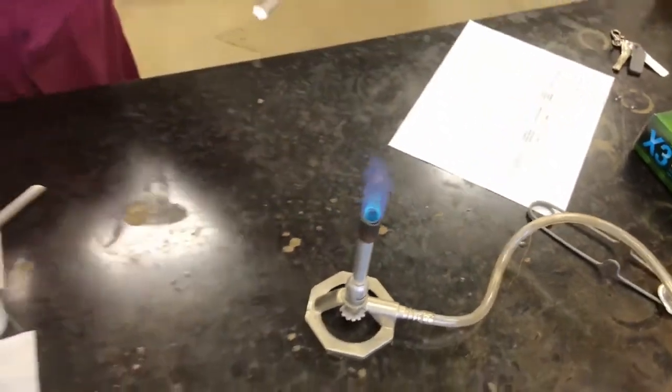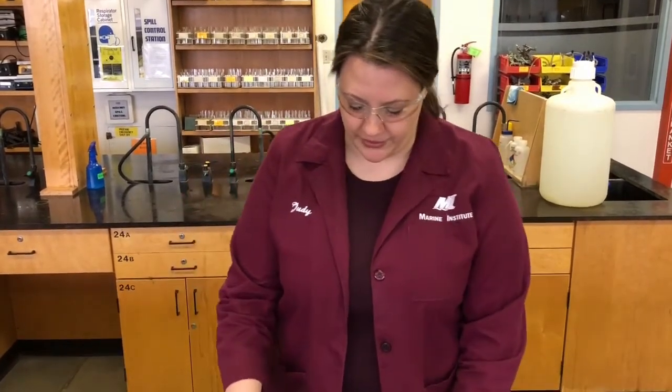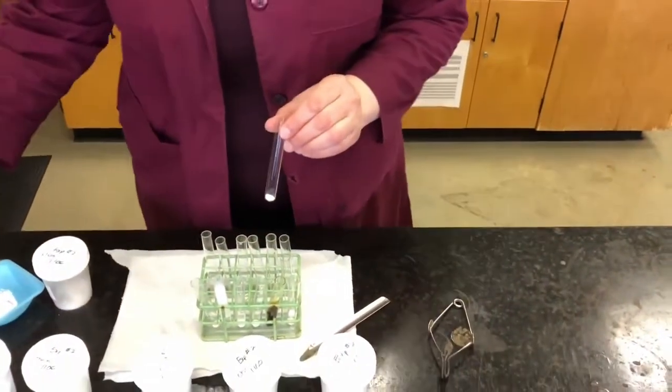So far we have a white powder with no effect from heat. So if you follow along with the results that you recorded from your known samples, it looks like it's chalk so far, okay? Because we had a powder, it's white, no effect of heat. So far those results correlate with what we got for chalk. So just to determine if that's actually correct, we will take a sample and dissolve it in water as well, to see if it's soluble.